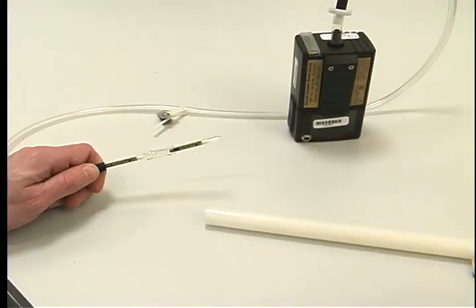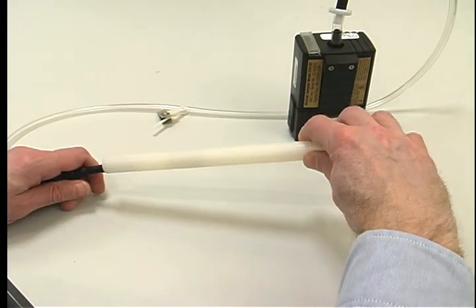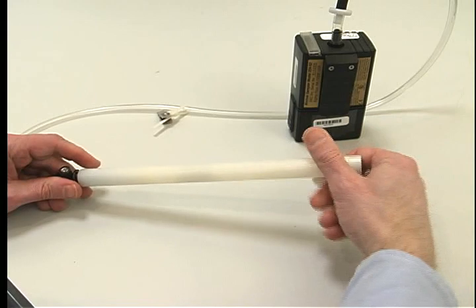Insert the open sorbent tubes just as you did previously, with both arrows pointed toward the pump. These sorbent tubes will be used for sampling. Place the appropriate size tube cover over the sorbent tubes and screw it in place onto the low flow holder.